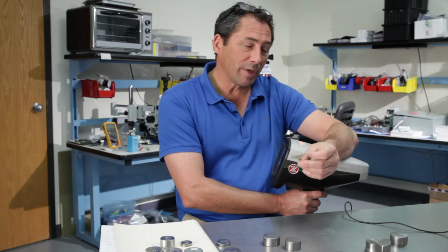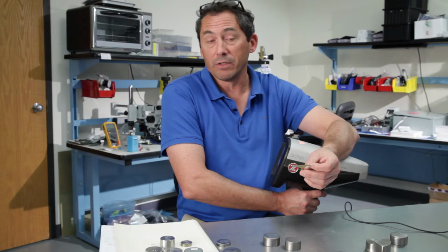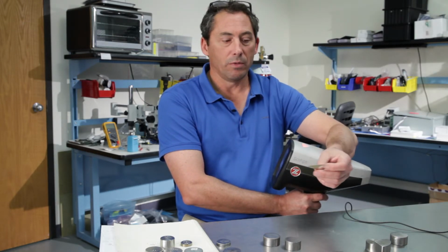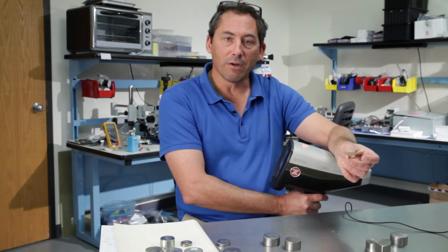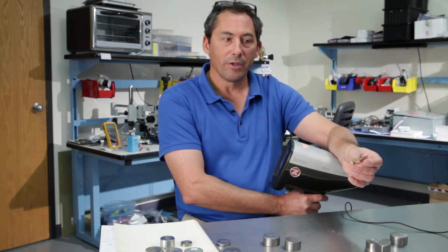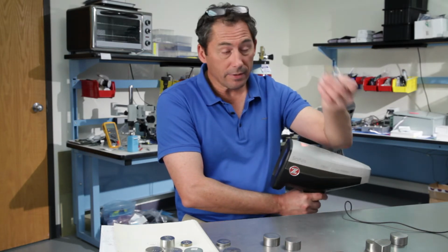So if you get something strange, unusual, you shoot it, you figure out what's in it, then you add a calibration if you want. But I think it's a very valuable tool just to be able to say, what's in this, and shoot it, and in 5 seconds, know. I don't think there's any instrument in the world that in a few seconds can tell you the elemental breakdown of some piece of material. So this is a great example.